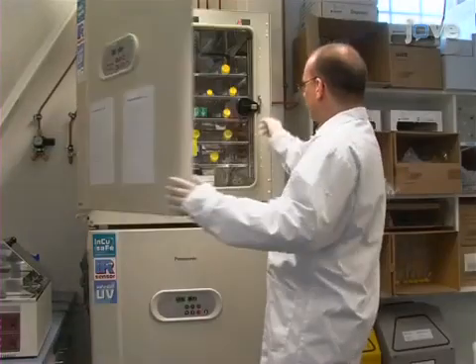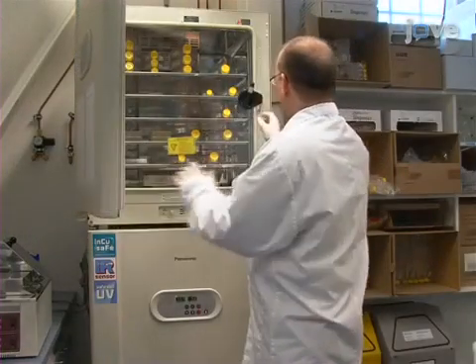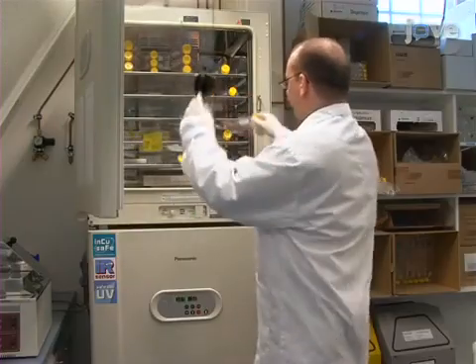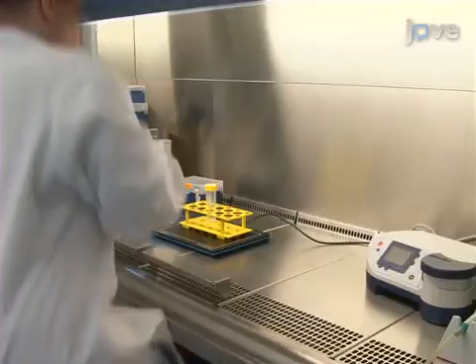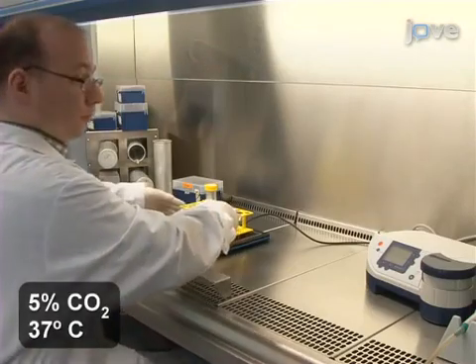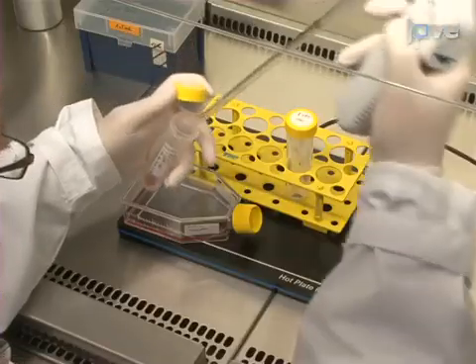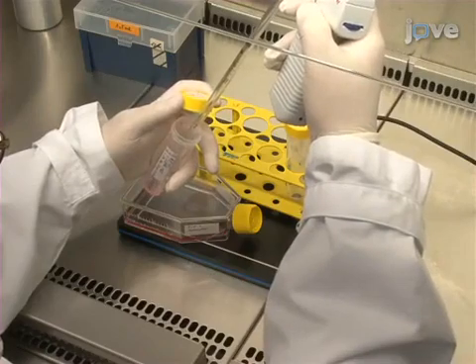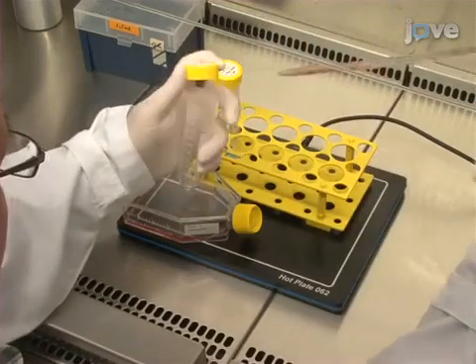For this protocol, have cultured THP1 cells in RPMI 1640 with 10% FCS and with 1% penicillin-streptomycin L-glutamine. 24 hours before the transfection, split the cells and provide them fresh media.